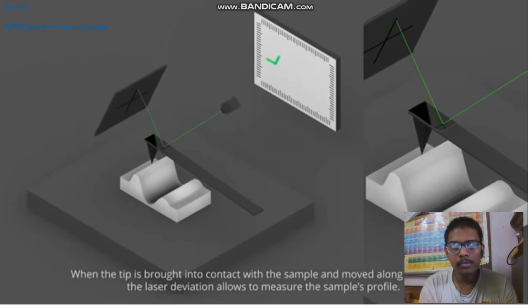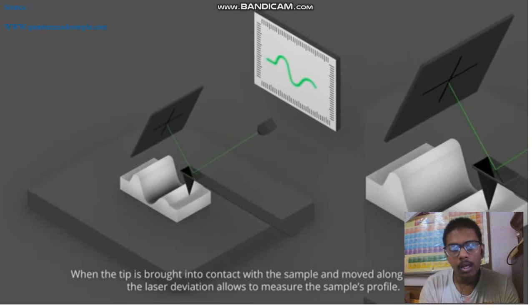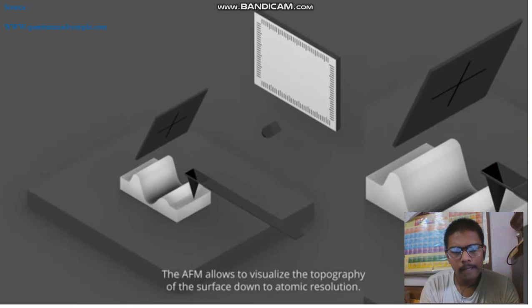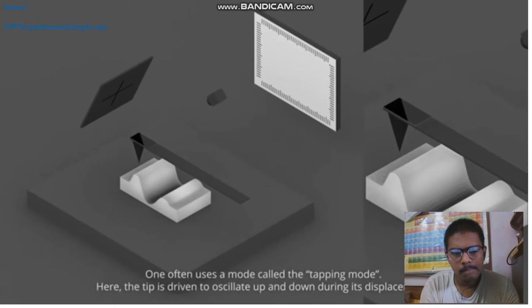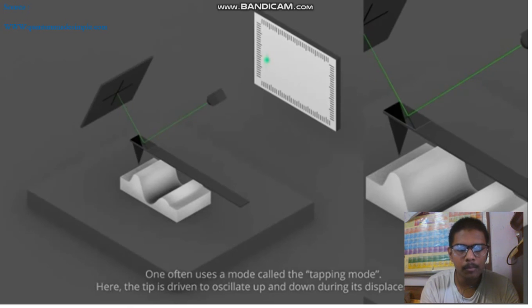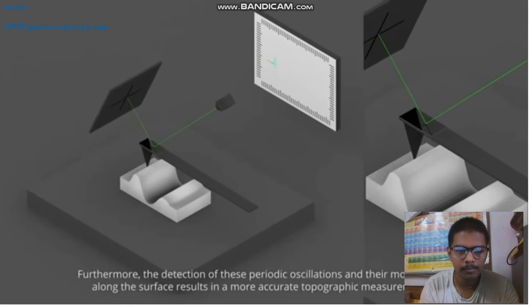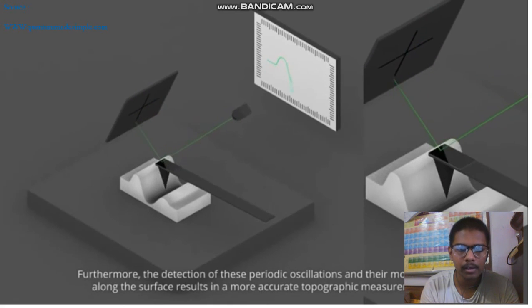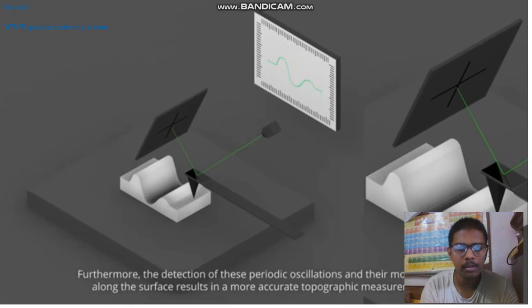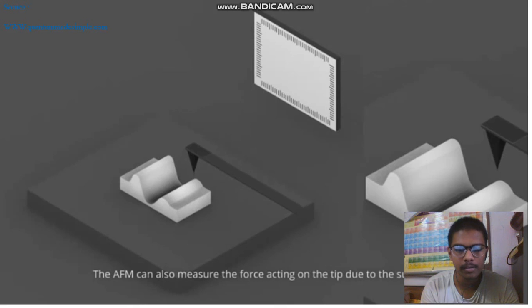Using the optical system and laser, the tapping mode will happen — vibrations along up and down — making the generation of signal on the screen. This periodic oscillation and its modification along the surface results in more accurate topographic results. You can also measure the force versus height, force versus z-separation, as we have discussed.